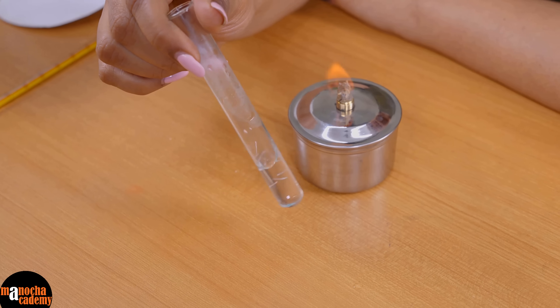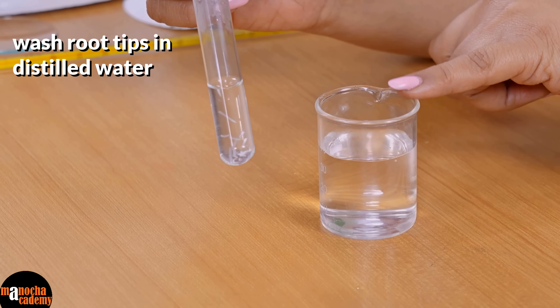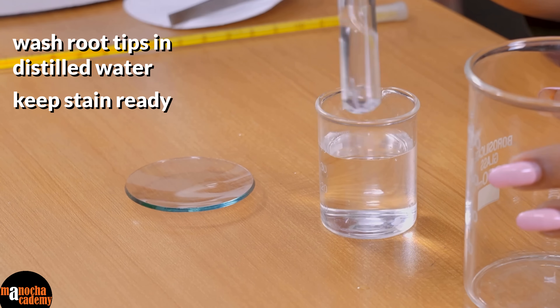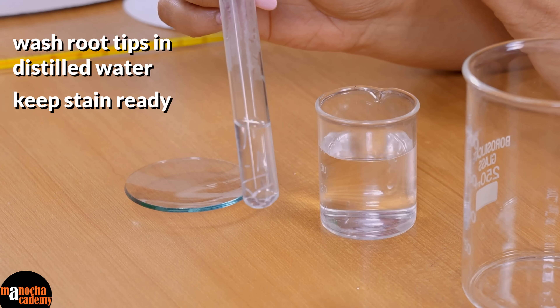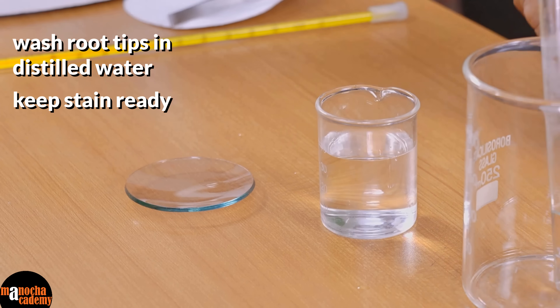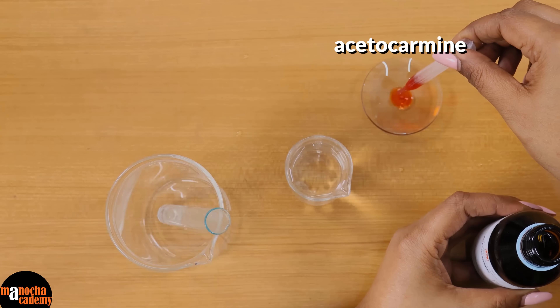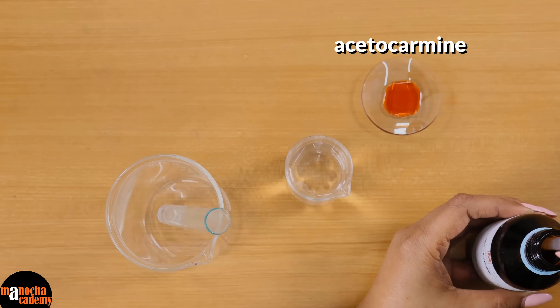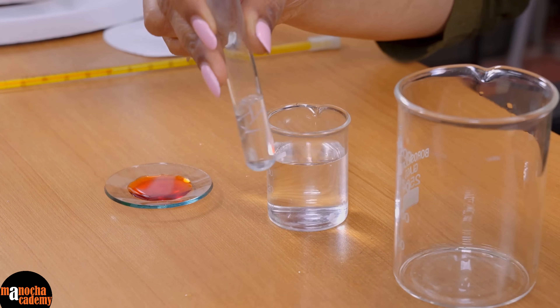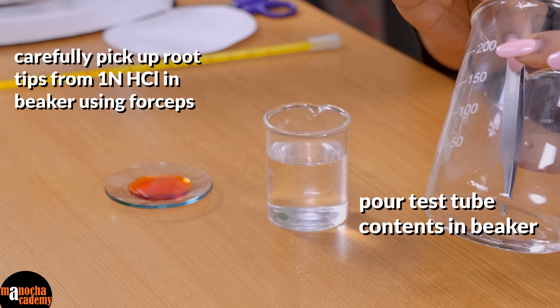This one is almost 70 degrees, so if I just allow it to cool down a little bit, within 2 to 3 minutes it will come down to 60. Now I will take the root tips, wash them in distilled water, and while doing so I will get the stain ready so that I can immediately put them in stain. I will not keep them in distilled water for a very long time because then water will go in and the cells do not show a very distinct structure. We will take some acetocarmine and put it in the watch glass, and then quickly pour the content into a beaker and pick up the root tips.